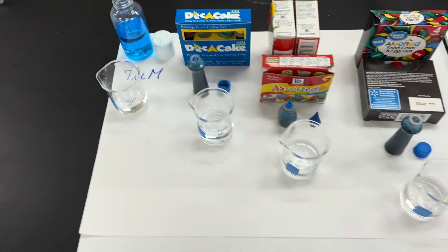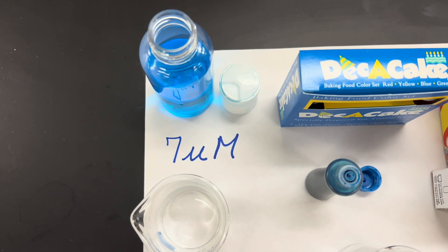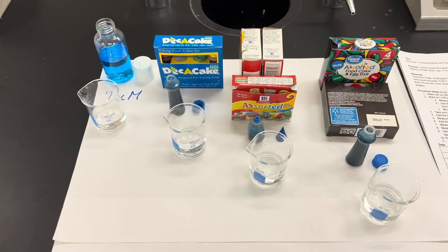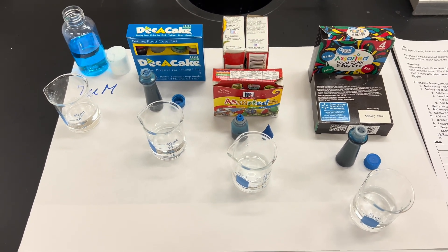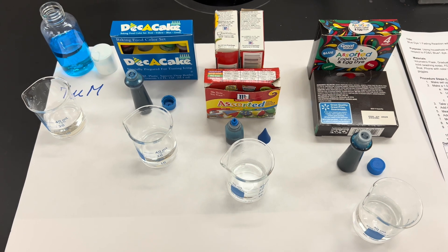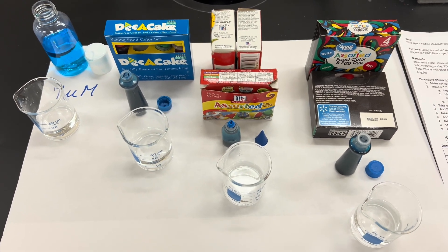Normally I use my pre-made 7 micromolar blue dye, but this year I tried to just grab some blue dyes that were around the school, and they didn't quite work out as planned — we had a new science experiment to solve.